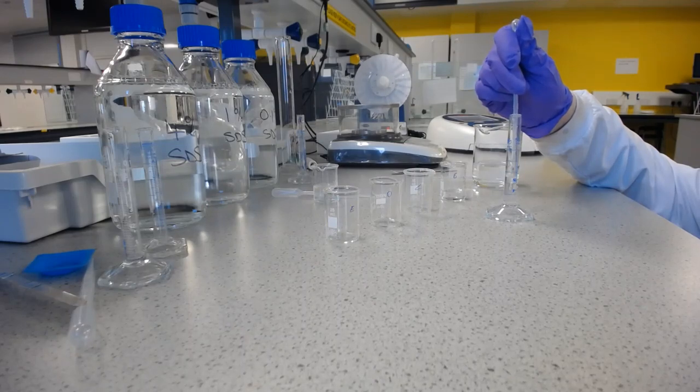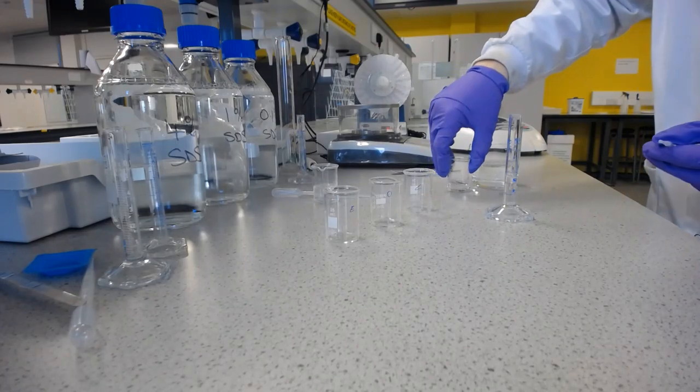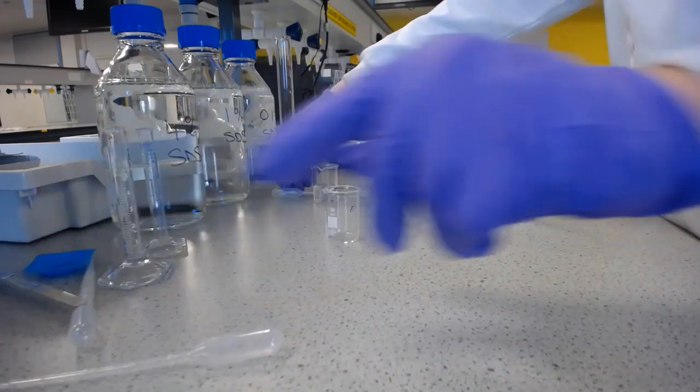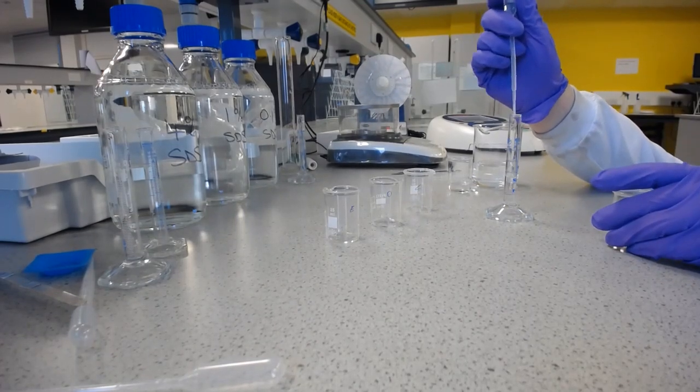Again. Okay. And then again, we need to have 7.5 millilitres of water.